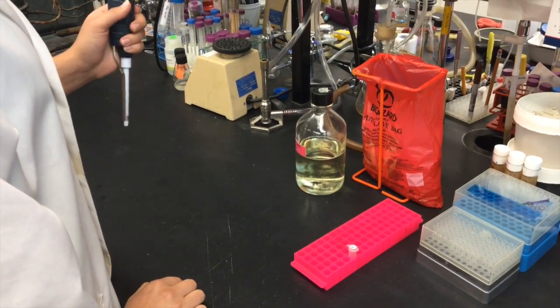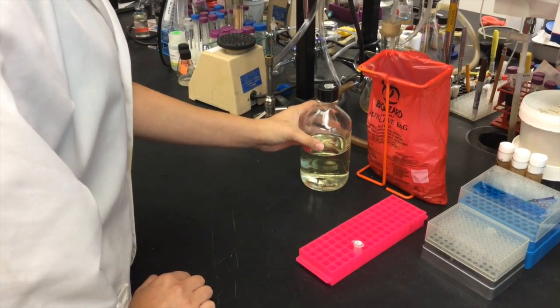Once you are finished, make sure to return all your equipment back to its proper area and clean up your workspace.